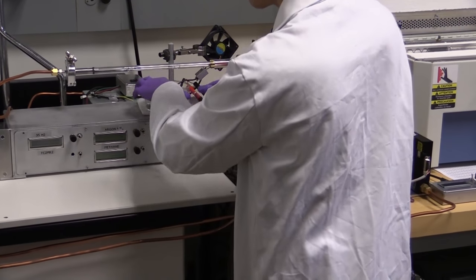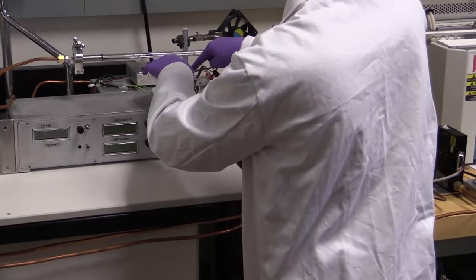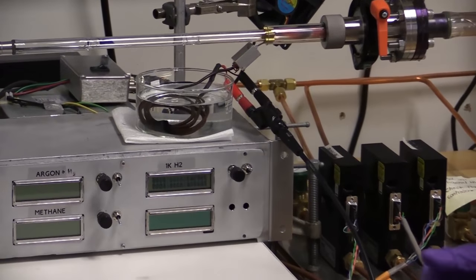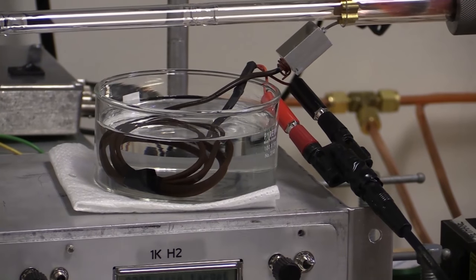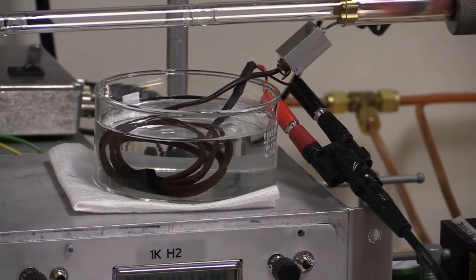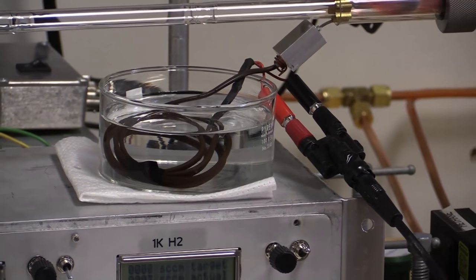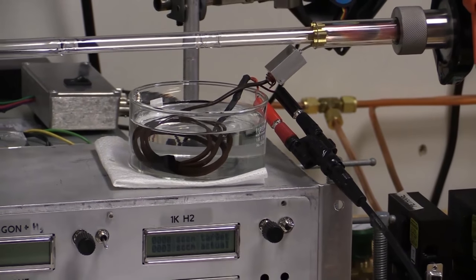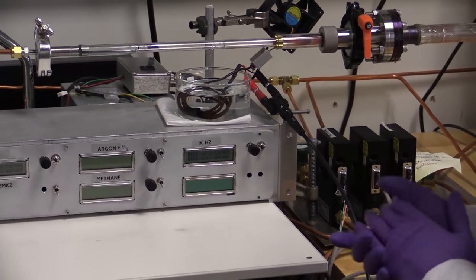Now, you may ask why we simply do not cut this wire and replace it with wire of more common copper wire of higher gauge. The issue is that the wire supplied is, in fact, thermocouple wire. If we were simply to cut it and replace it with copper, we would introduce a new type N to copper interface, which would then cause an offset to our readings. And then we wouldn't have as high-accuracy calibration for our temperature.